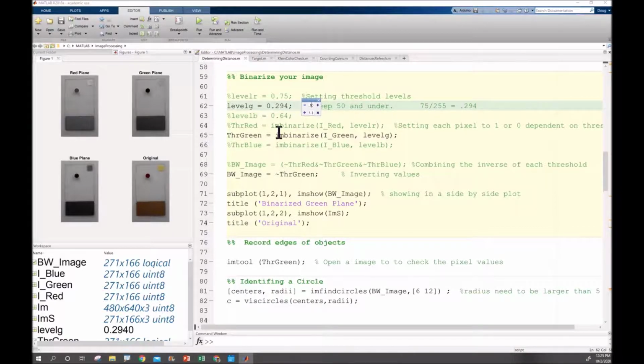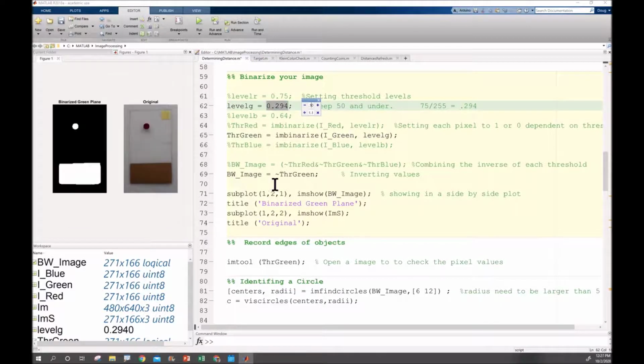I then run this code right here, which is going to take values and set them to either 1 or 0, depending on which side of the threshold they're on. This is the image I'm bringing in, and this is my threshold. What I'm seeing is actually an inverted value, so I put this little tilde in front of my image to set it to my black and white.